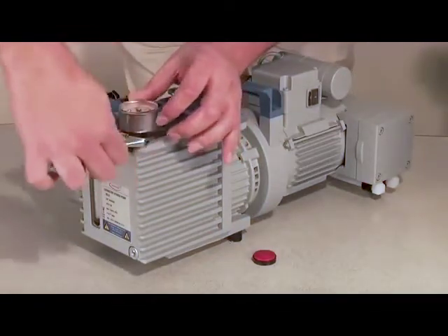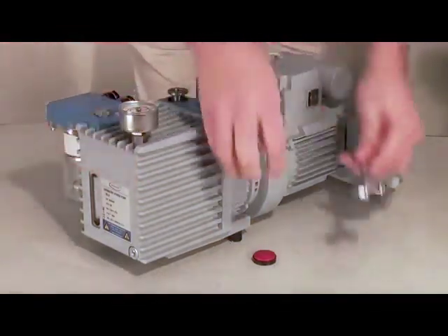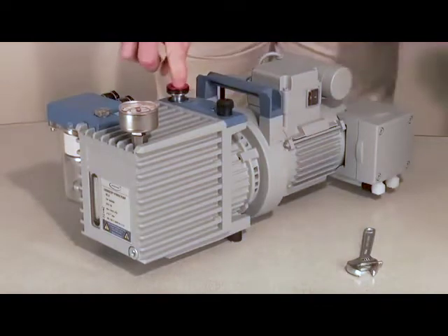Reinstall the manometer and o-ring. Turn the pump on for five to ten minutes with the inlet closed.